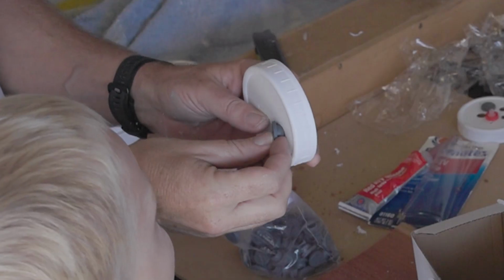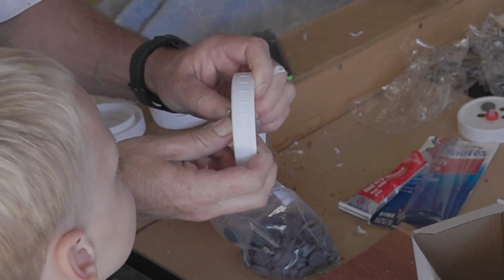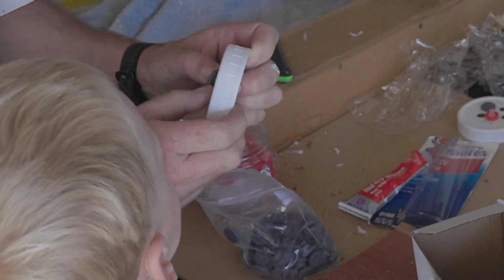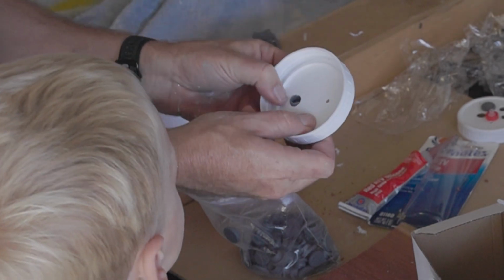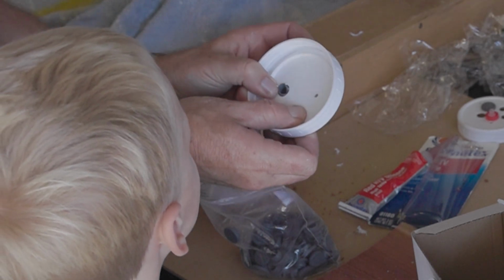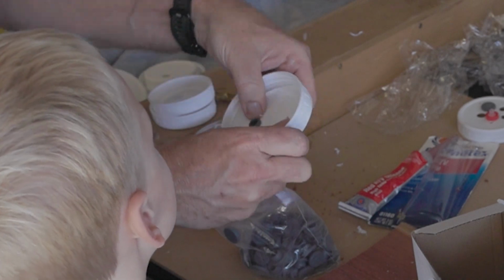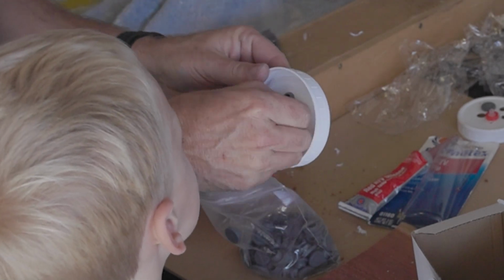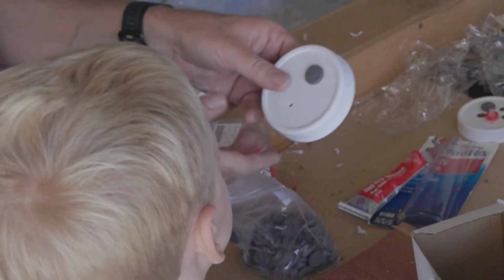All right, it's a really tight fit. You push it through. Right there, you're trying to get that into the hole, and if you can get it all in the hole, then maybe you can grab some of it on this side. And you just work it in. Boom, boom, boom. That's a super tight fit. Boom. See?